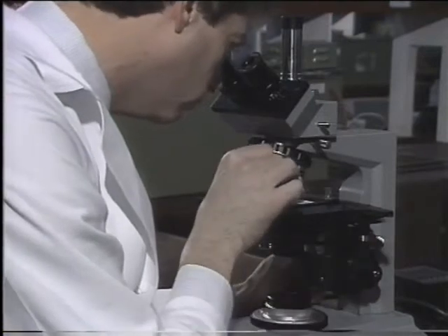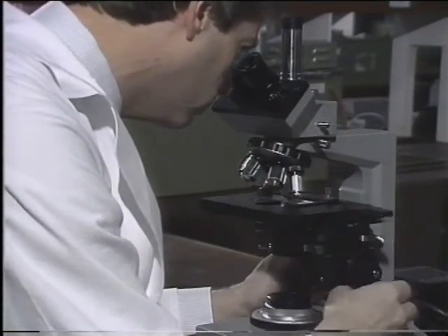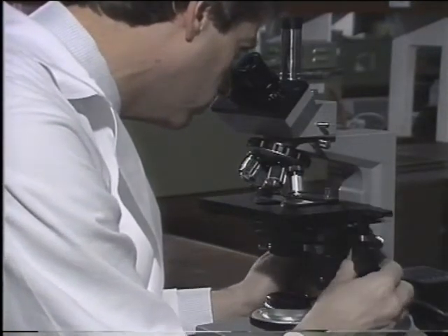The most obvious thing inside the cells is the nucleus, with its dark edge. If you look carefully, though, you may also be able to see some thread-like structures in the cytoplasm. These are the mitochondria. They're only a few micrometers long, and it's difficult to make out any details of their structure. You might think it would help if the magnification was increased.